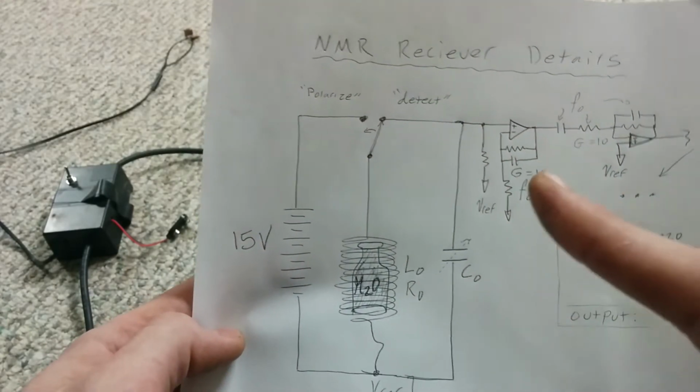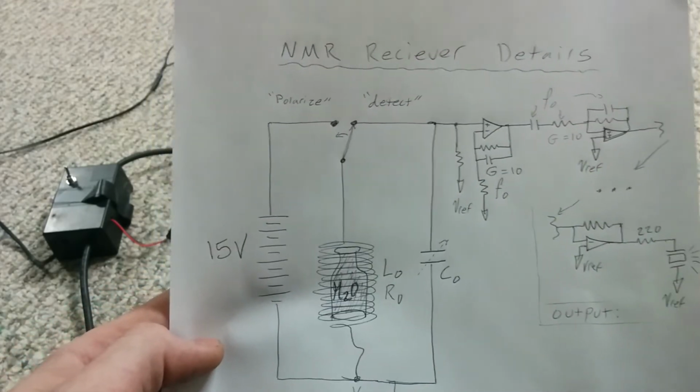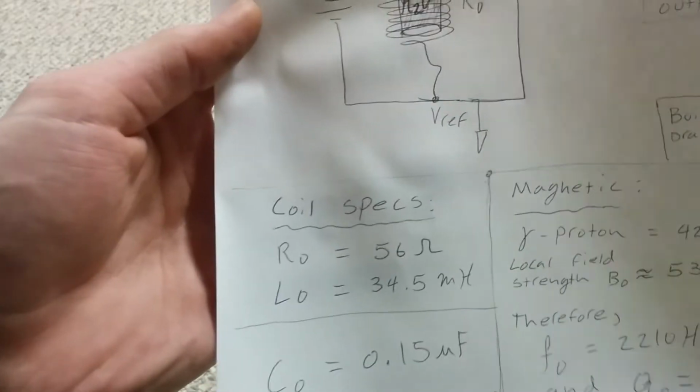And they're probably something like 30 per stage by the time I was through with it. So that's the rundown on that. In terms of computing the frequencies of interest, well, let's start with the coil specs.